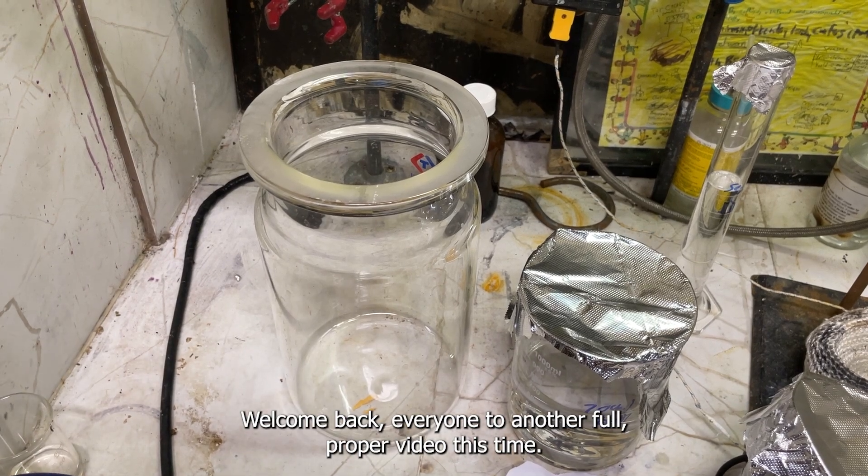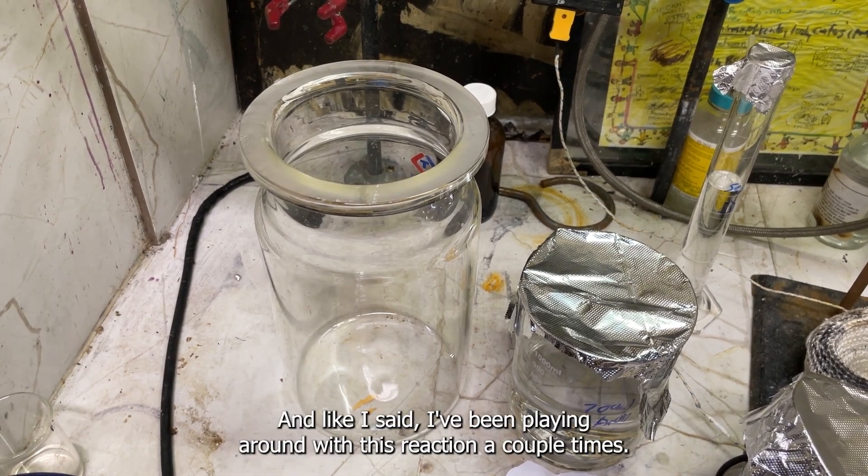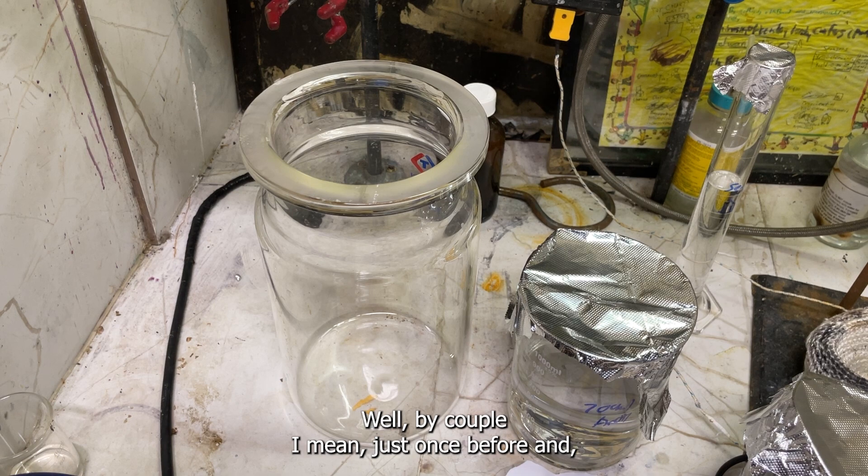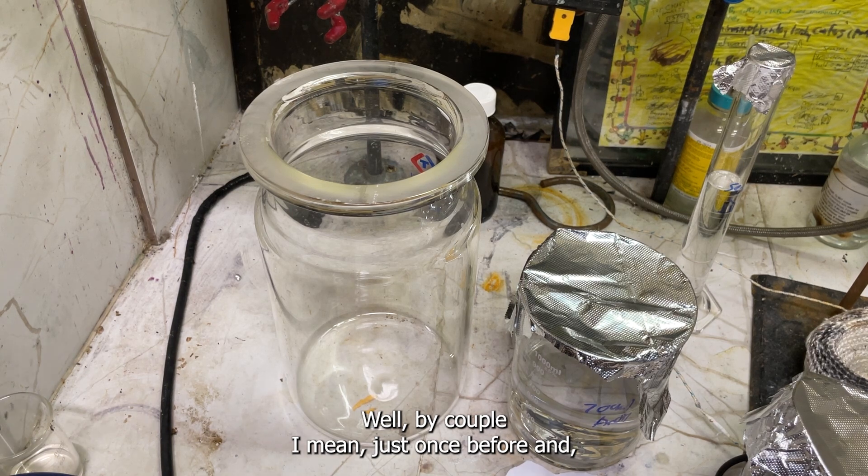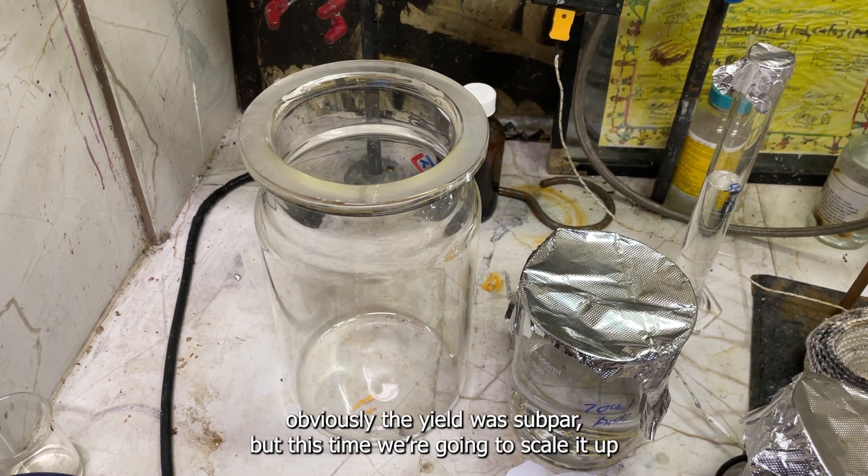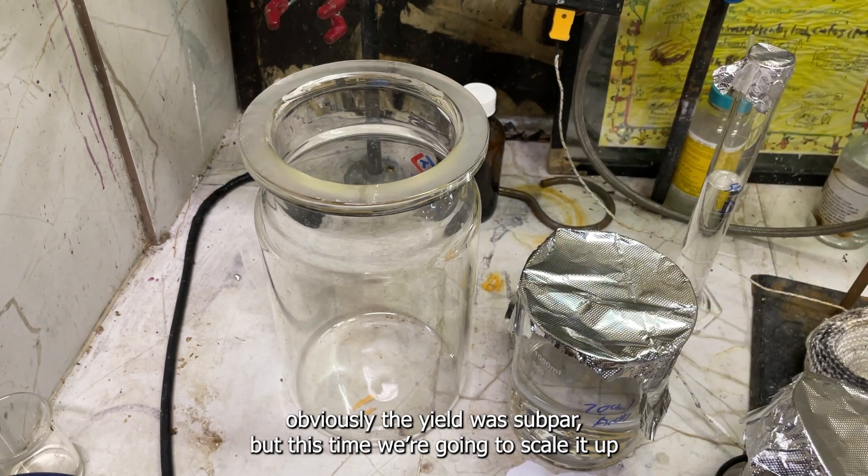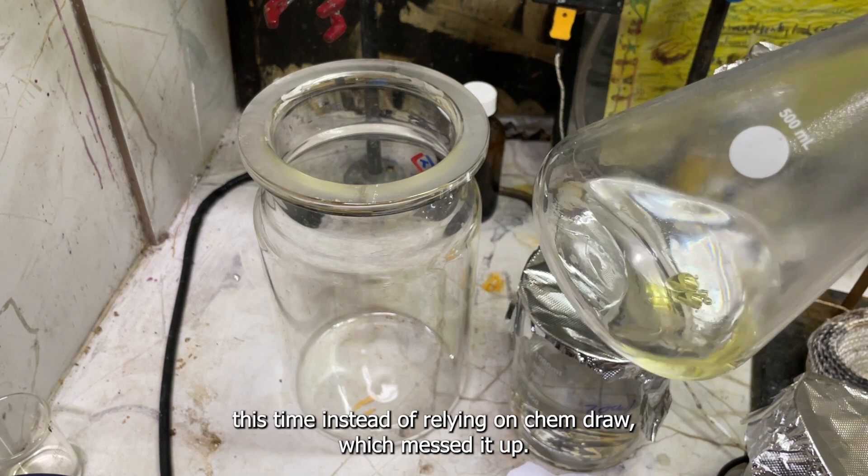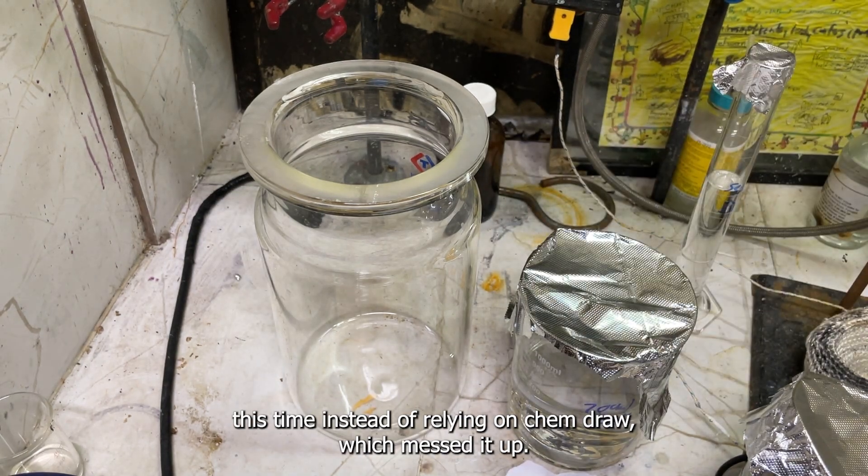Welcome back everyone to another full proper video this time. I've been playing around with this reaction a couple times, well by a couple I mean just once before, and obviously the yield was subpar. But this time we're going to scale it up and do it properly, because I did the stoichiometry by hand this time instead of relying on ChemDraw which messed it up.